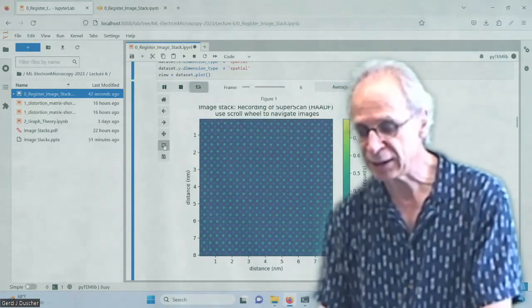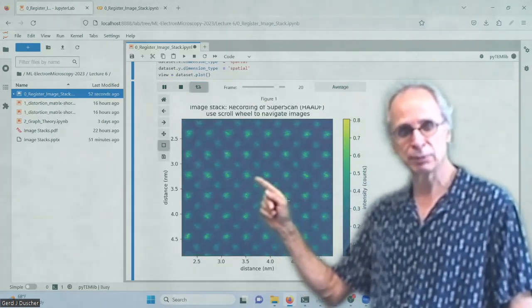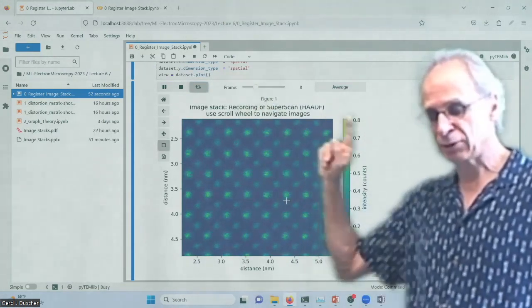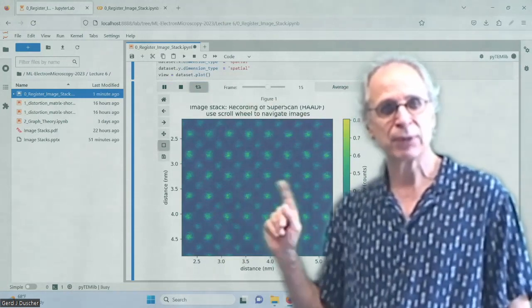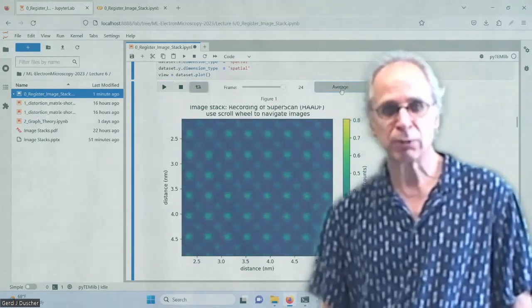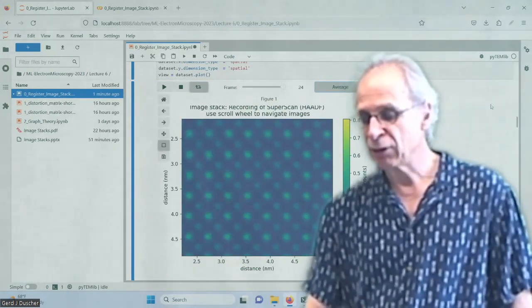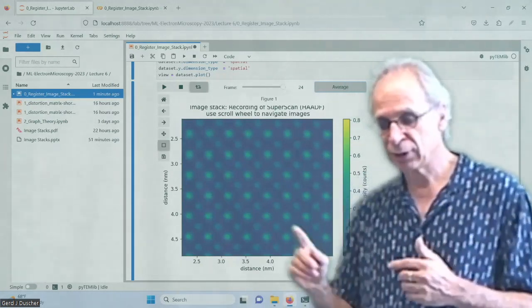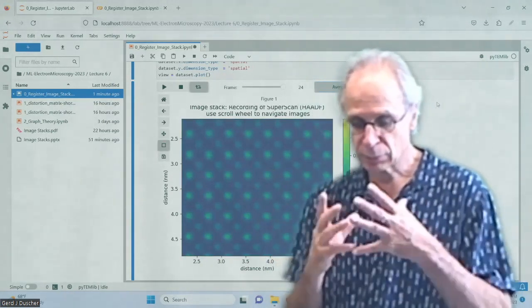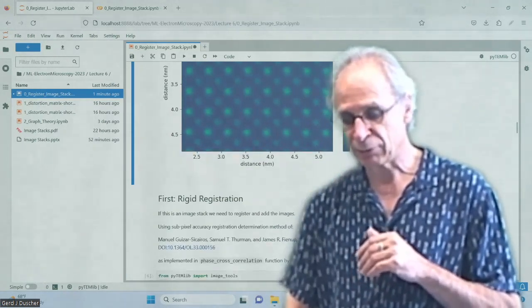And we can see how we have very little movements here, right? So that we have a drift, and when we jump back from 0 to 1, we have this shift of 3 pixels, and we don't want that. Under normal circumstances, people would probably just average that and say, okay, it's good enough. The problem is you will have slightly elongated atoms. And the key thing is, if you align a microscope, you want to have round ones.